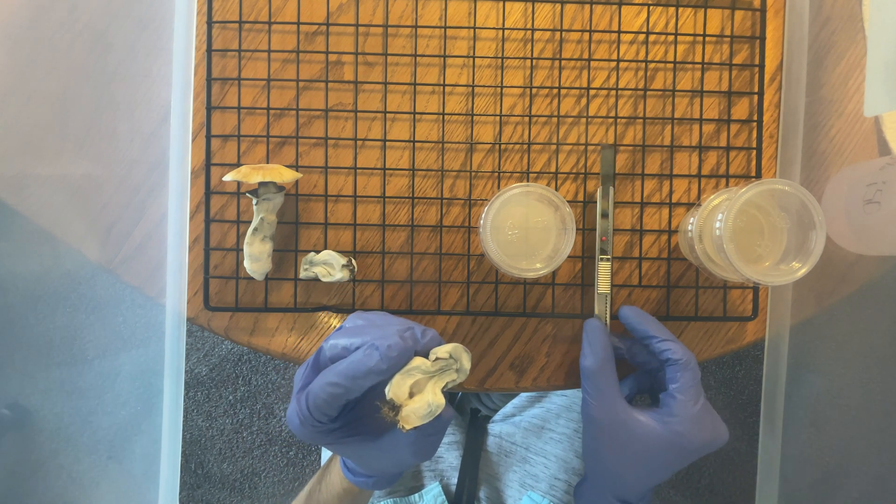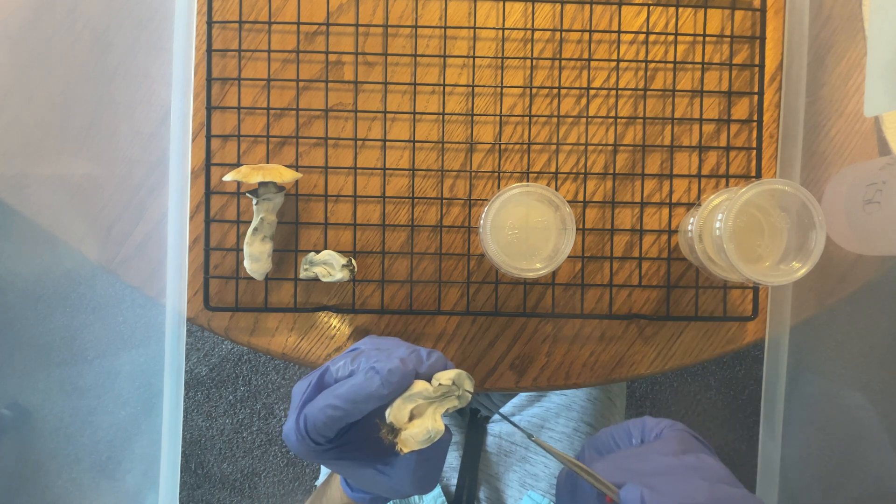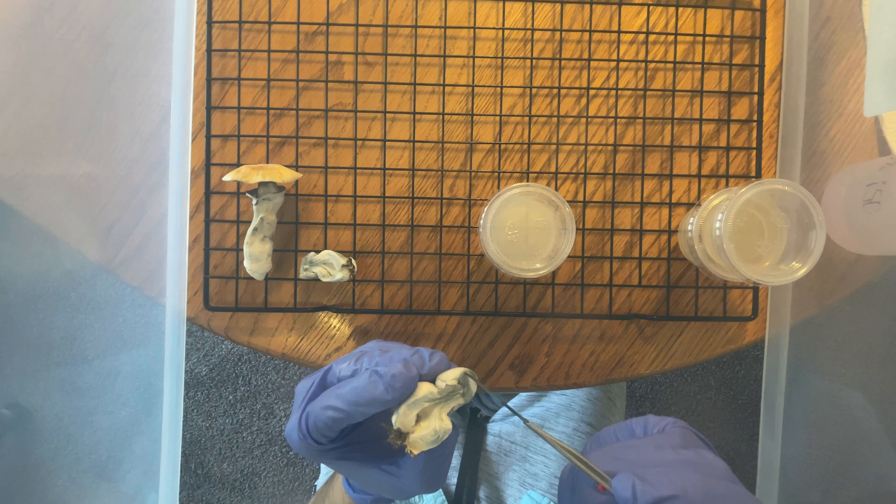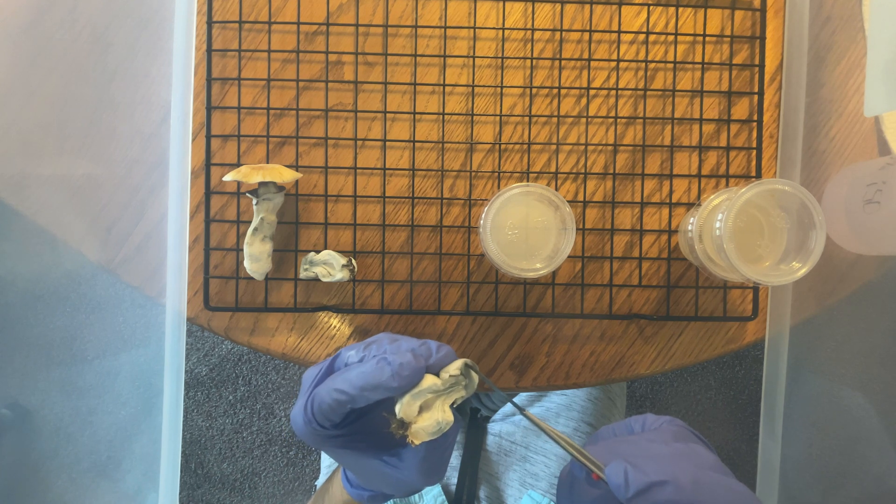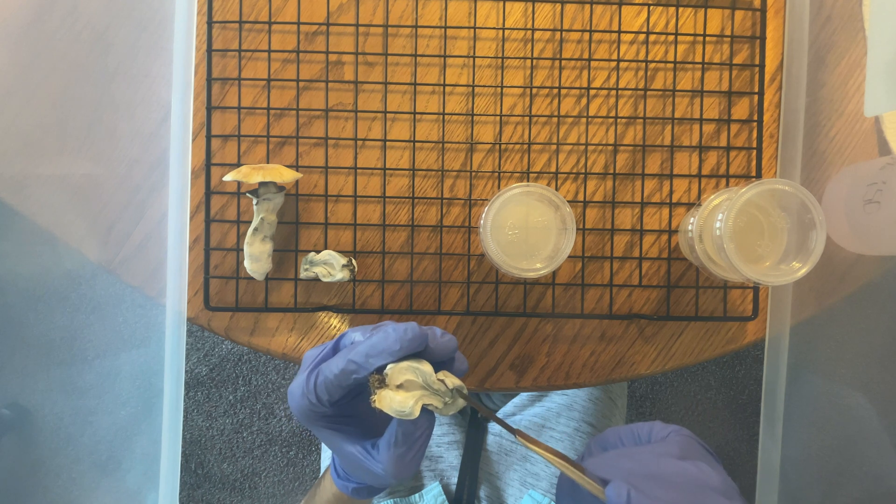This time around, I'm cloning from tissue in the area of the cap. Now from my understanding, you can take tissue from anywhere in the fruit and it will come up with the same results, but that would be a really cool idea to try out sometime and experiment with it too.